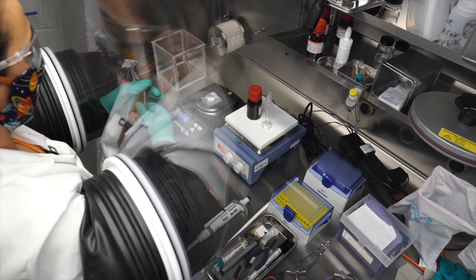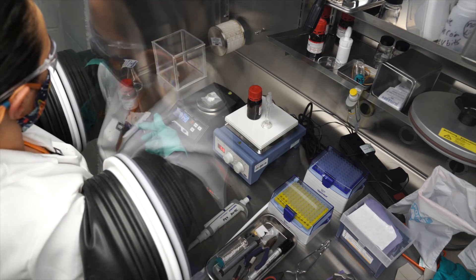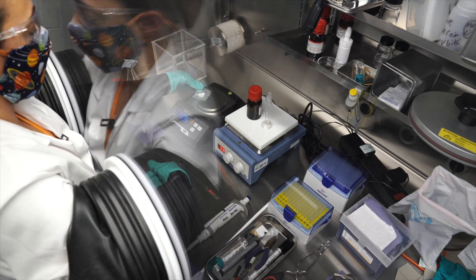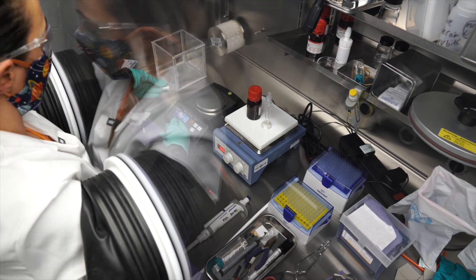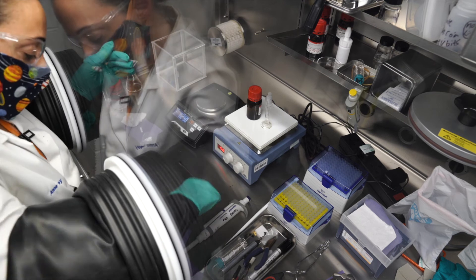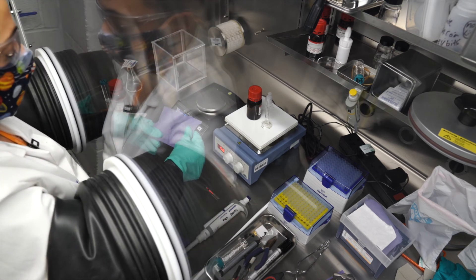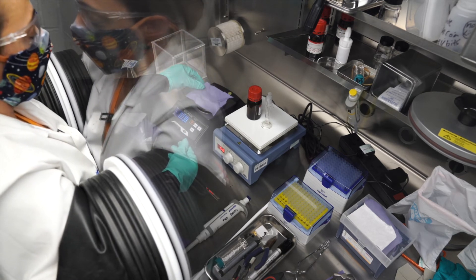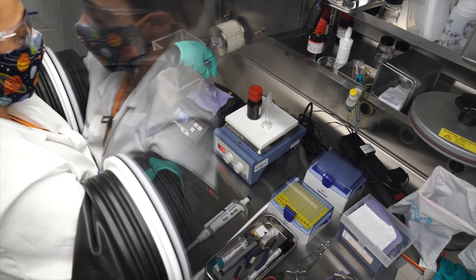Cap this to prevent further contamination. Carefully move this off the scale. And because I am clumsy and tend to drop salt when I weigh it in, I'll have a wipe to catch spillage.